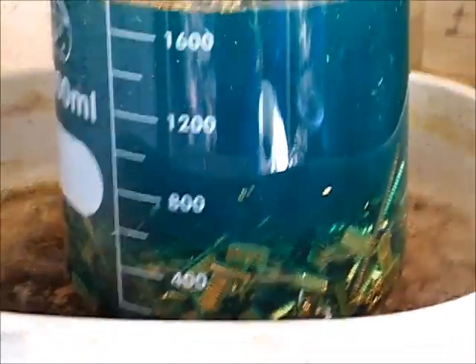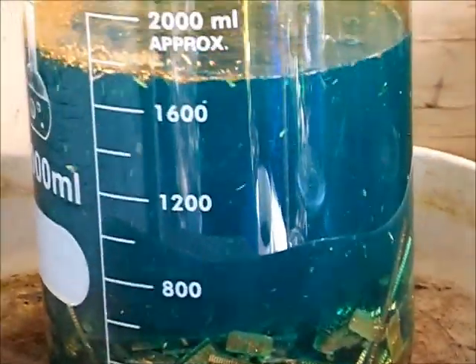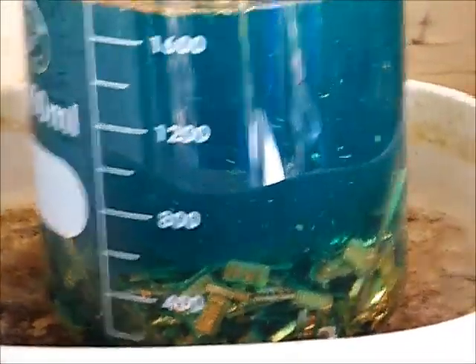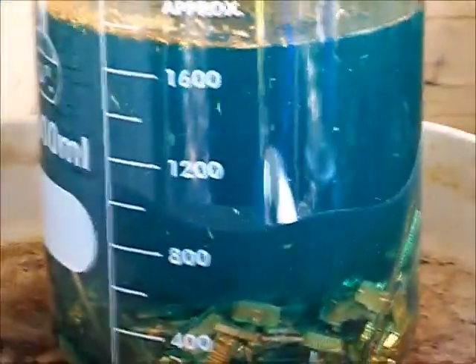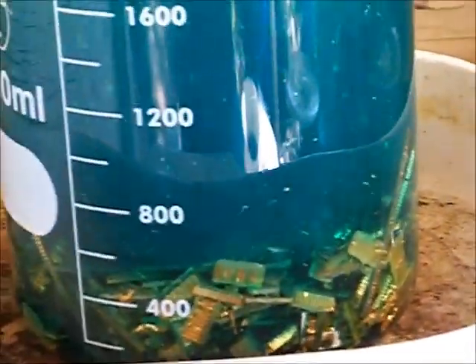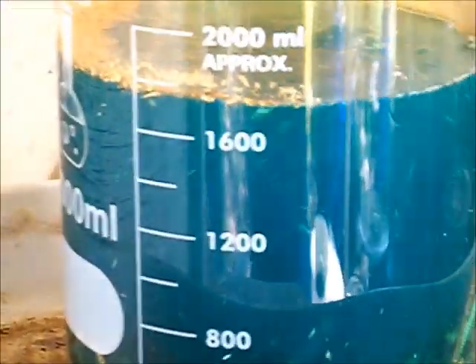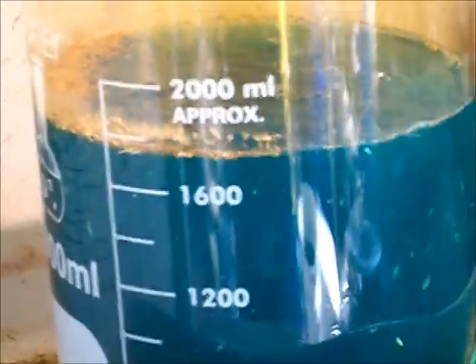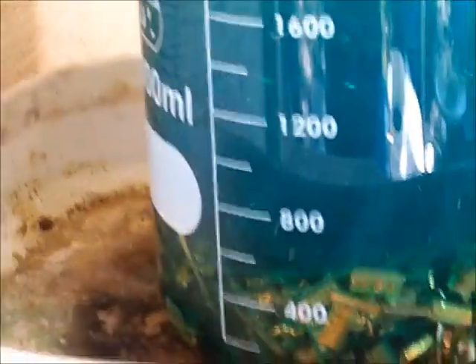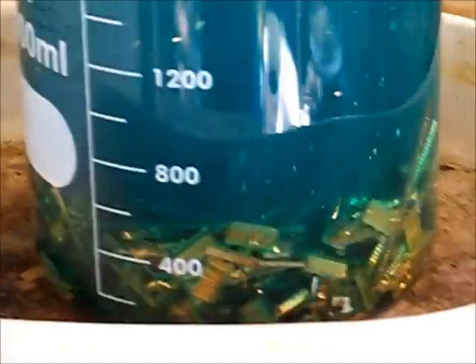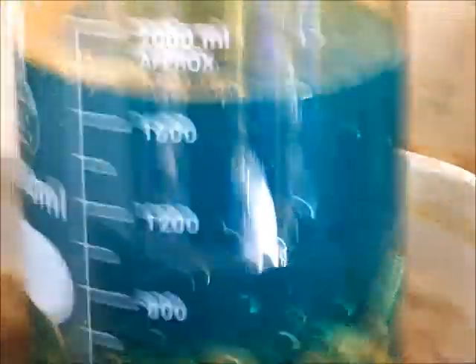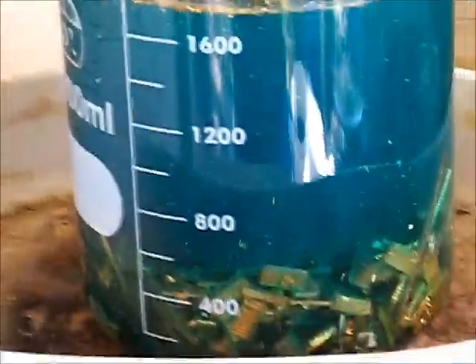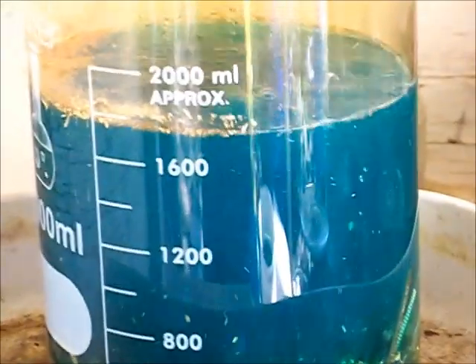It's been an hour and the reaction is going strong. Now we've got reaction bubbles, these small little reaction bubbles, telling you that it's dissolving the base metal. You can see the gold foils being released, foils that are just flying around in there.